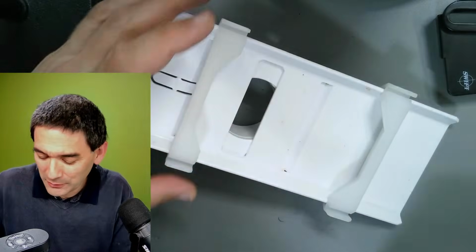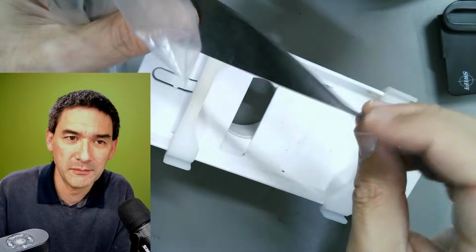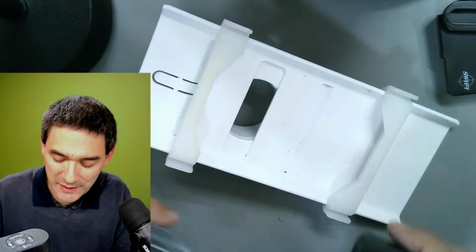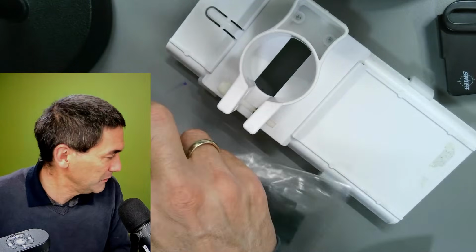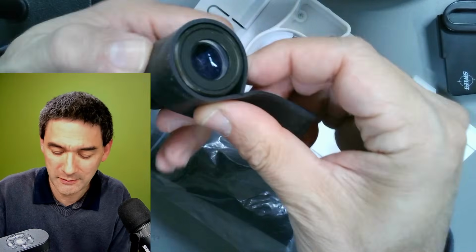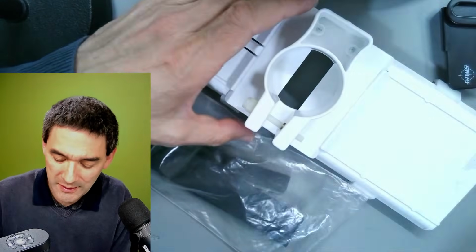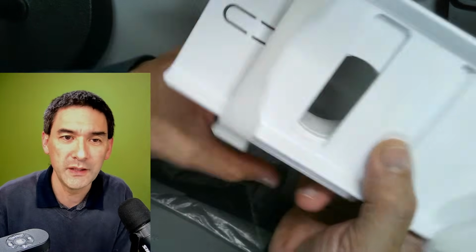And not only that, there were also a whole bunch of rubber, how do you call this, rubber pieces that you can wrap around the eyepiece to make sure that the diameter is correct. It works like this: you have to wrap the eyepiece around, like this, until it's thick enough, and then you clamp it in here. There's a little screw, and so it's clamped in place here, and then the whole system allows you to center the camera by moving it like this, right?